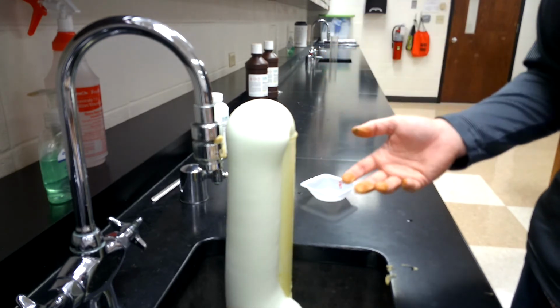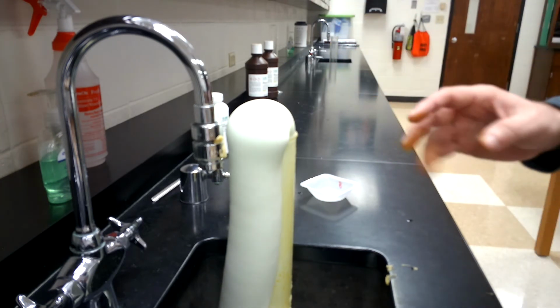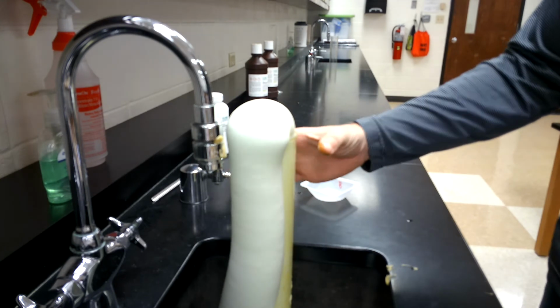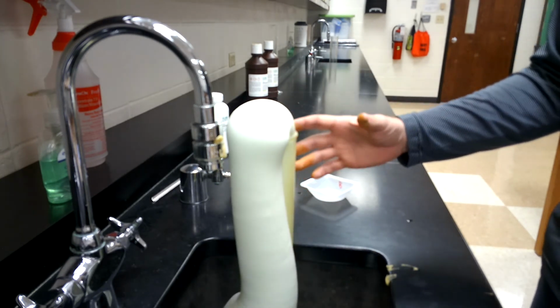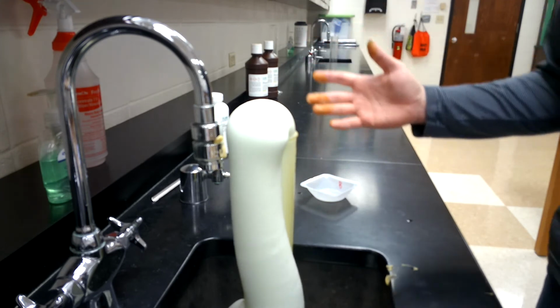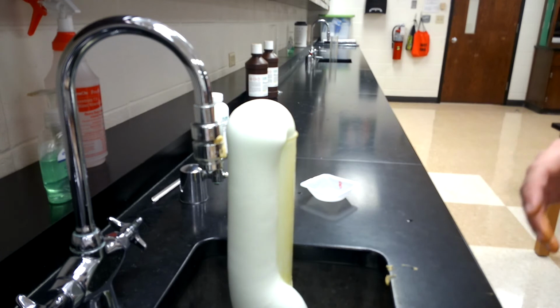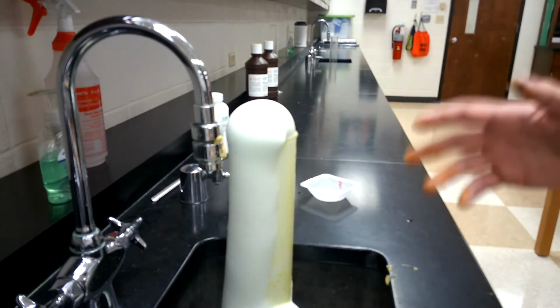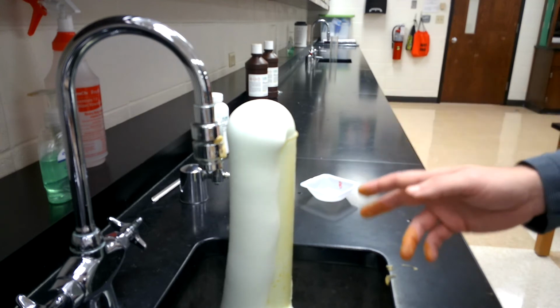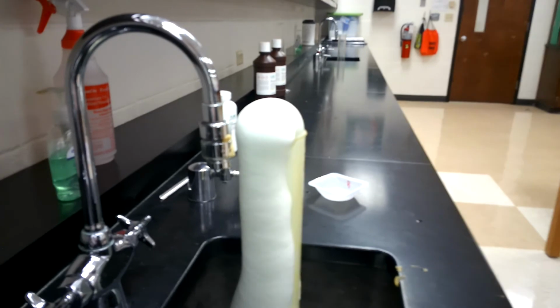Some of the videos I shared where it's flying all over the place. Two things going on there. First, I picked a very large beaker, so there's not a whole lot of pressure that can build up over this large surface area. I did that because I don't want the ceiling stained. I don't want to replace ceiling tiles. Our custodians wouldn't be happy with me. And second, usually they don't use store-bought Walmart hydrogen peroxide for their experiments. So let's move over one lab bench here.